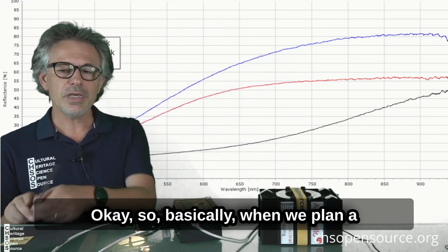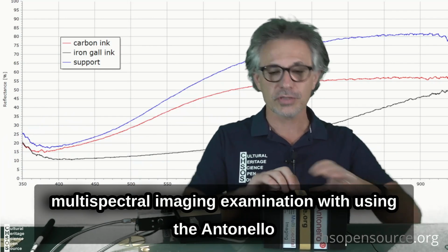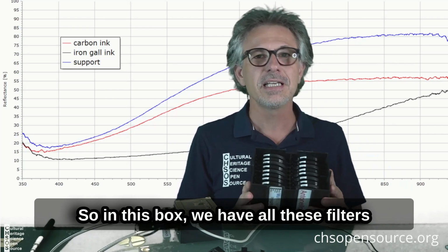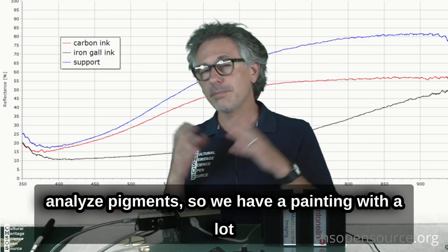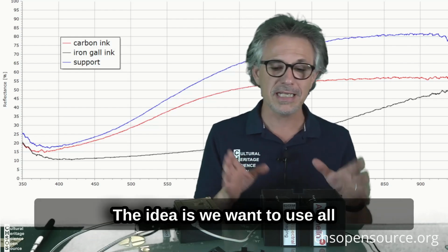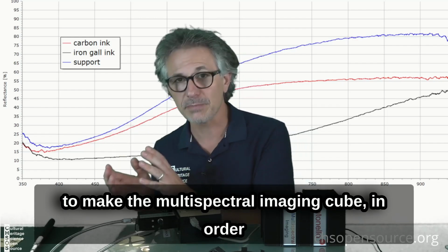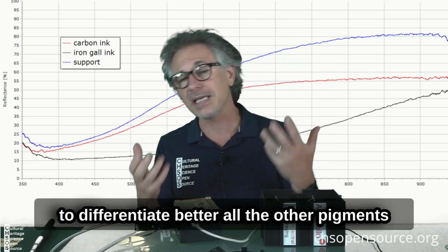Okay, so basically when we plan a multispectral imaging examination using the Antonello system, where we have 18 filters, so in this box we have all these filters, the idea in general, when we want to analyze pigments, so we have a painting with a lot of different colors, red, yellow, blue and so on, is we want to use all of them in our multispectral imaging examination, then to make the multispectral imaging cube in order to differentiate better all the pigments.